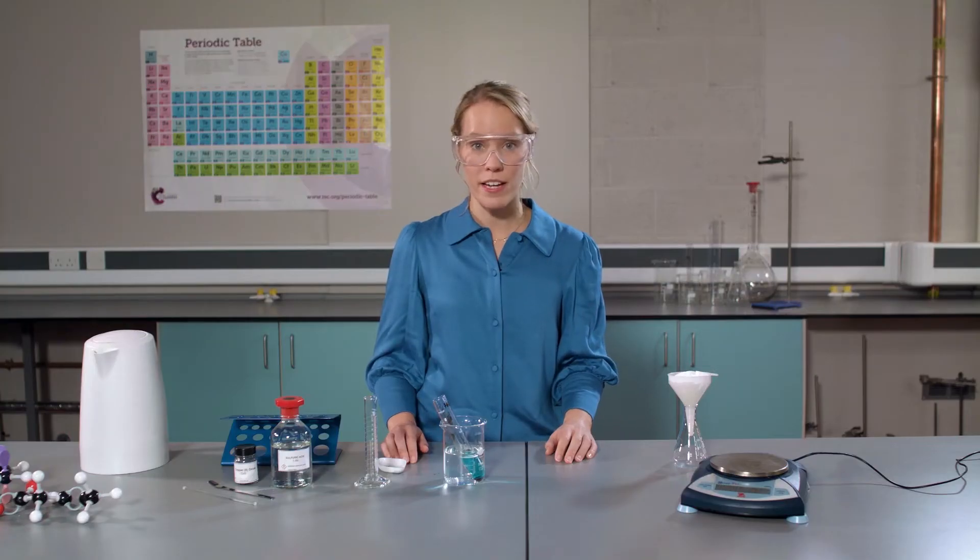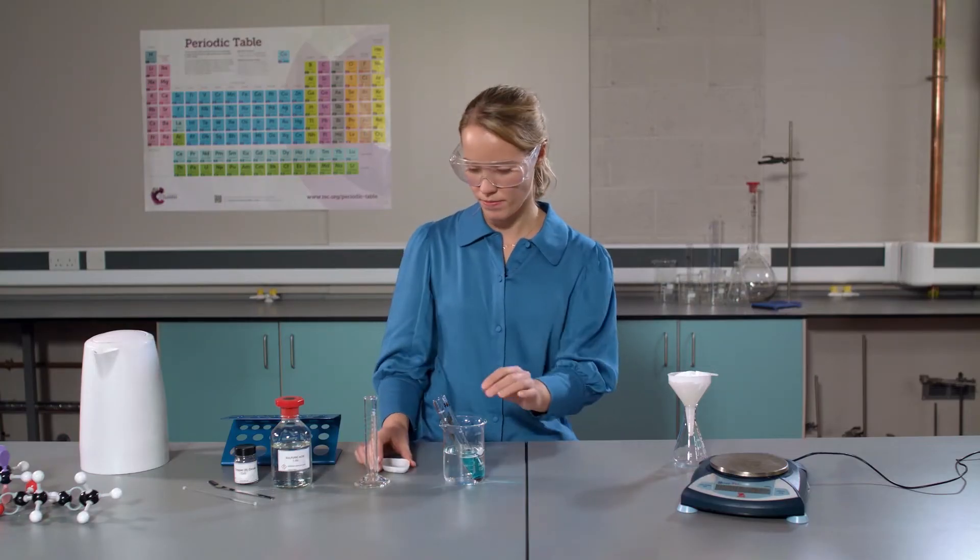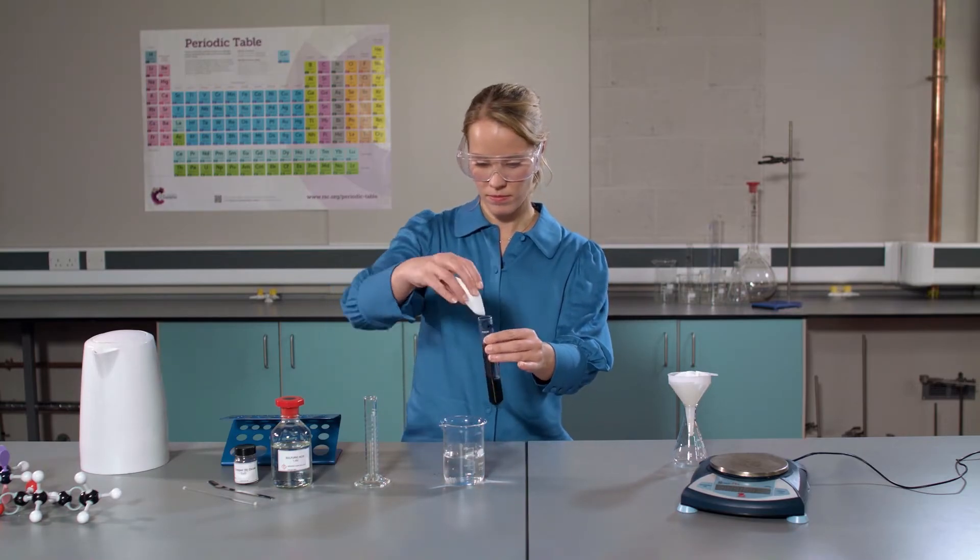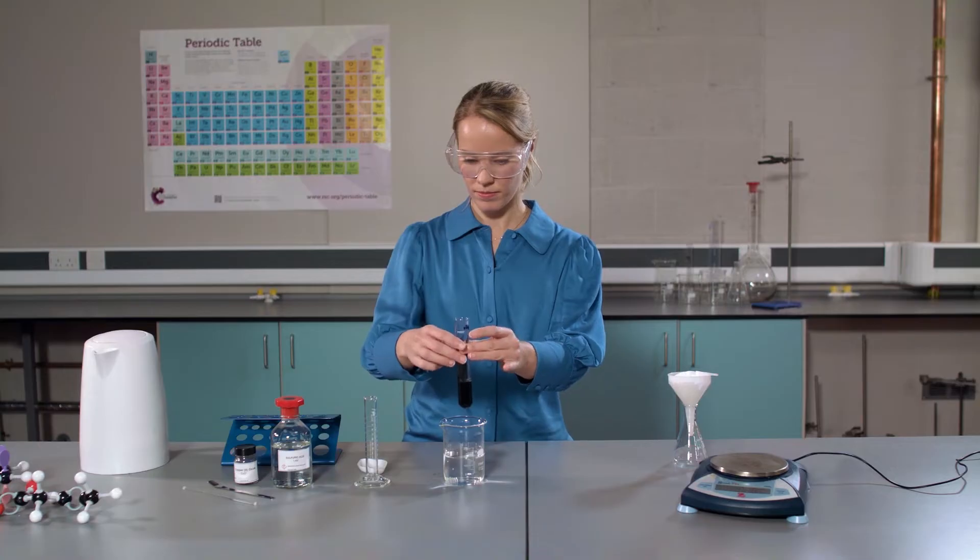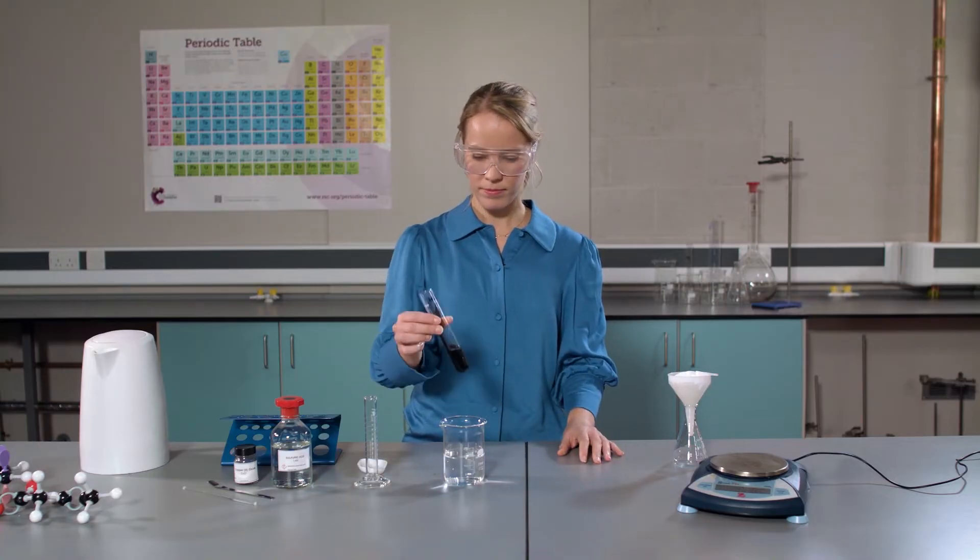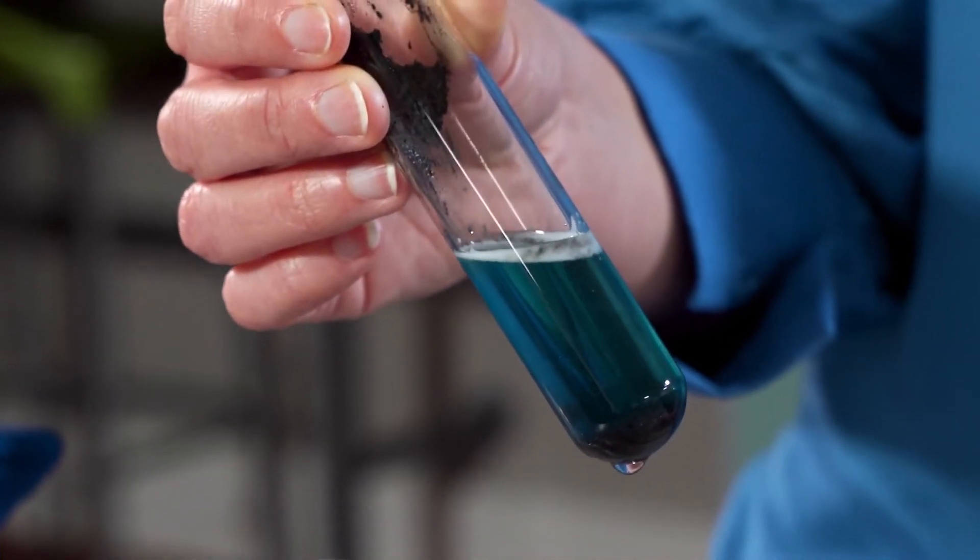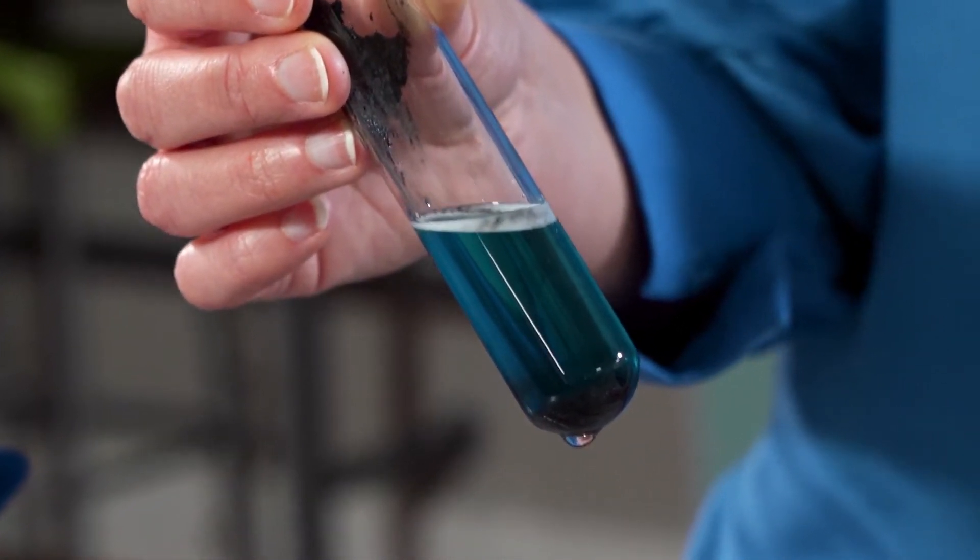When the reaction subsides, add the rest of the copper oxide. You'll notice that some of the black copper oxide powder remains. Let's take a moment to think about what has happened here.